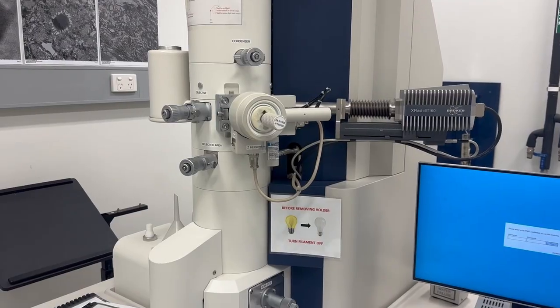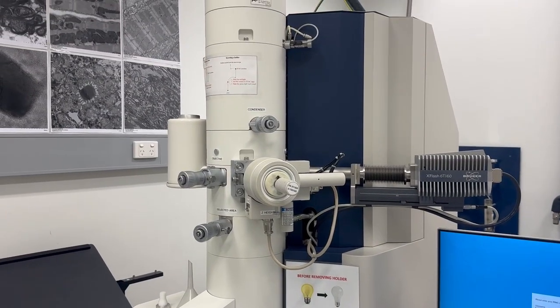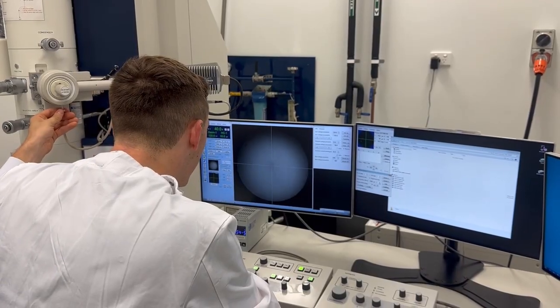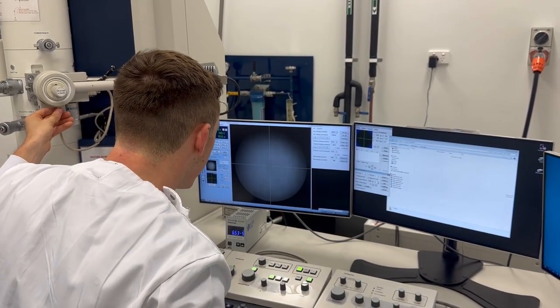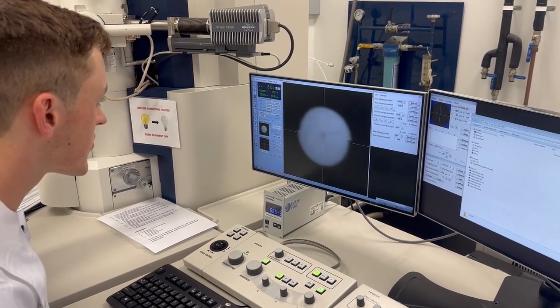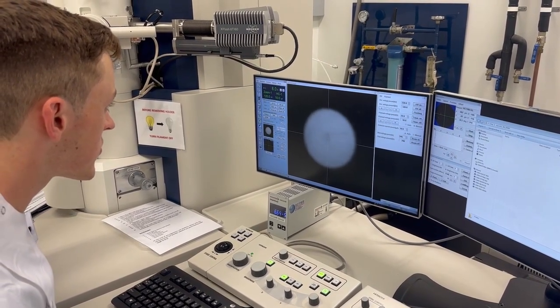Connor is using a transmission electron microscope to check the quality of our vaccine candidate proteins Q and Z. These are very high-powered microscopes for viewing super tiny proteins. Instead of using light to view the proteins, like our eyes or a regular microscope, they use a beam of electrons.